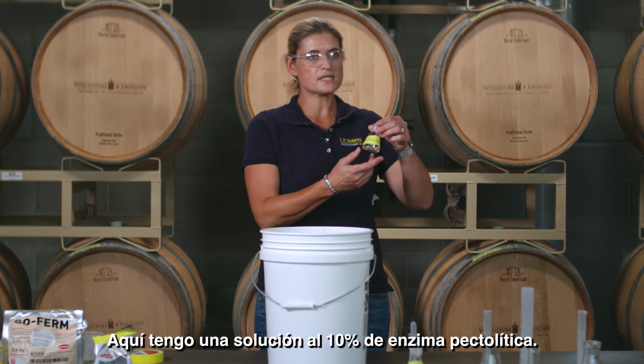Now, if you use another enzyme, just go and use the guidelines of the manufacturer, or if you use something like Color Pro that's already come in a liquid form, you will add about half a milliliter to this amount of must. There are different enzymes recommended for white or red grapes, so please use the correct enzyme solution. Now we are ready to start preparing our yeast solution for our inoculation.